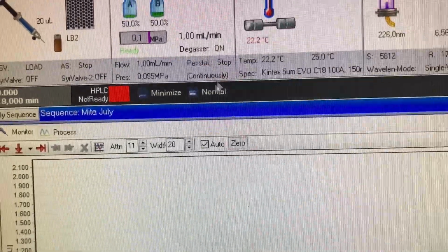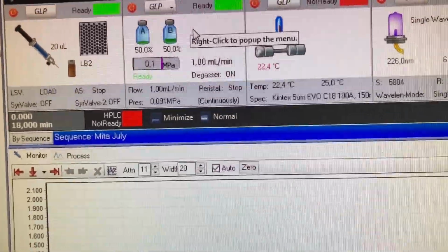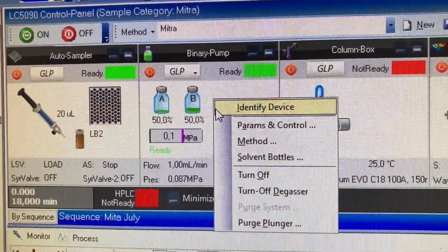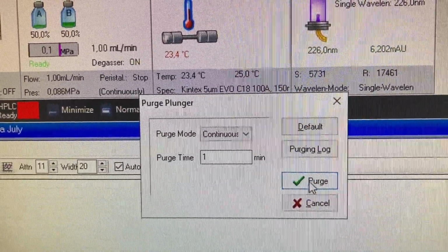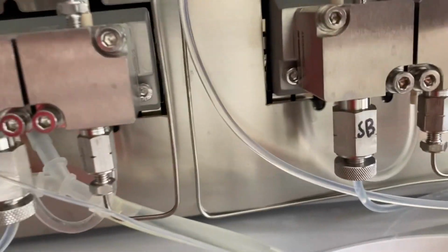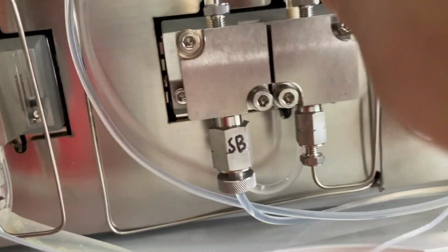And this is all preparing to do the washing and clearing the system of air. So right click. Oh, purge plunger. There it goes. It's been a while since I've done this. And 1 minute, that looks good. Now you see this is all open up. So it's getting rid of all the air through the system before connecting it up to the column. I'm going to do this about 3 times.